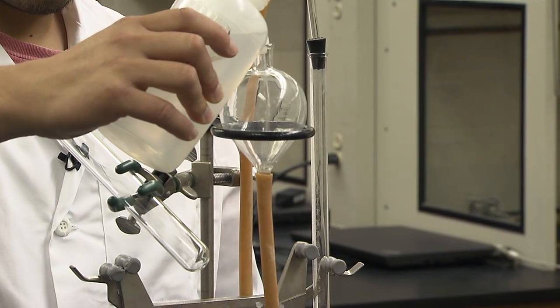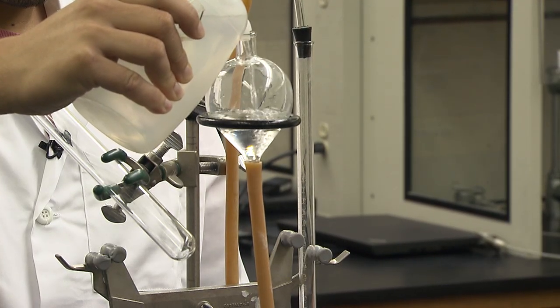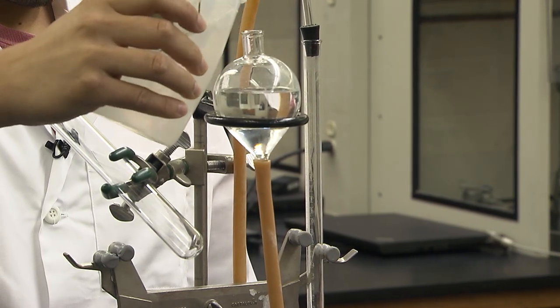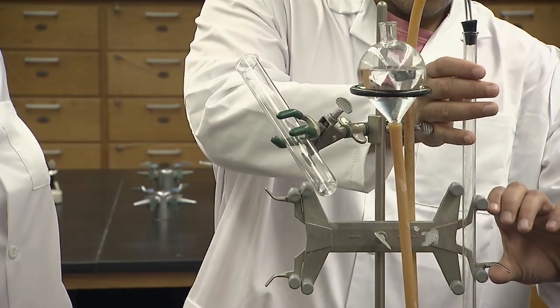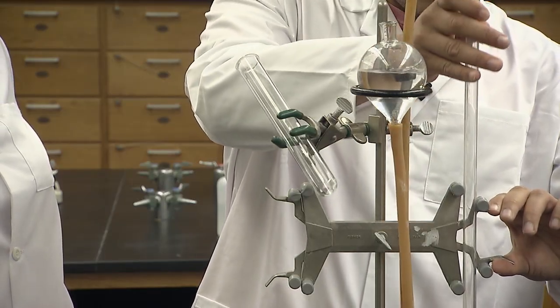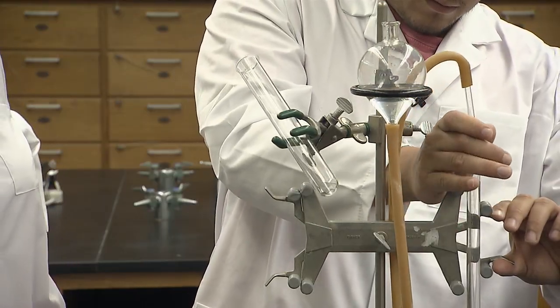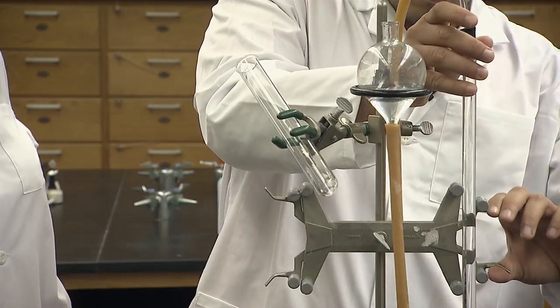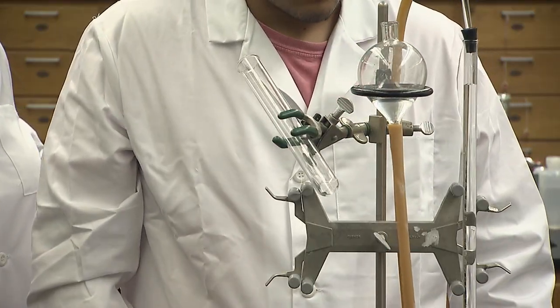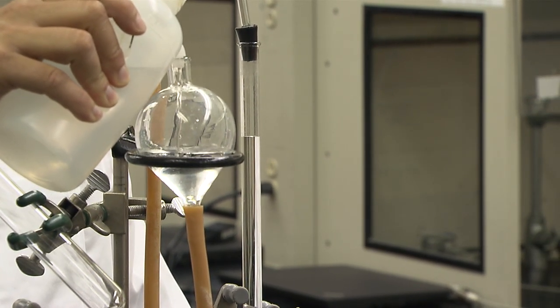Now fill the bulb with water. You will have to move the bulb to encourage the air bubbles to escape the hose. The water should reach the same level in the burette as the leveling bulb. You may need to add more water to get the bulb half full when lined up with the 0 milliliter of the burette.